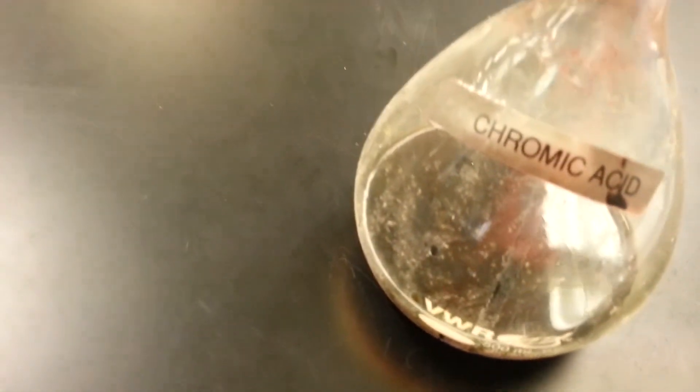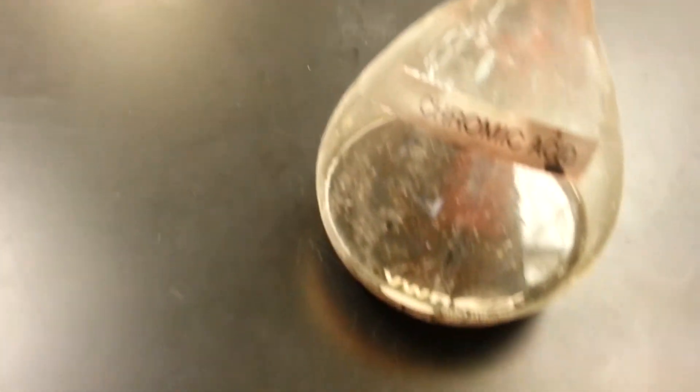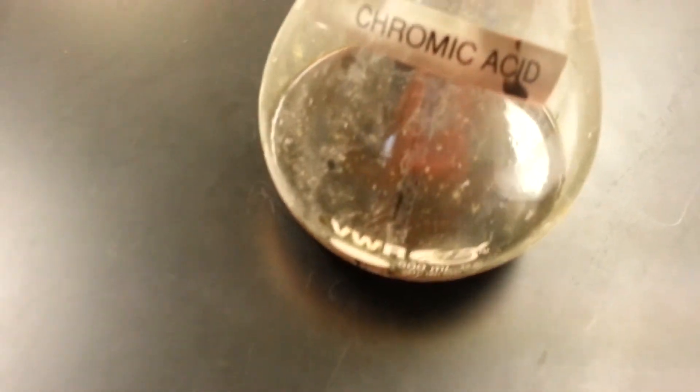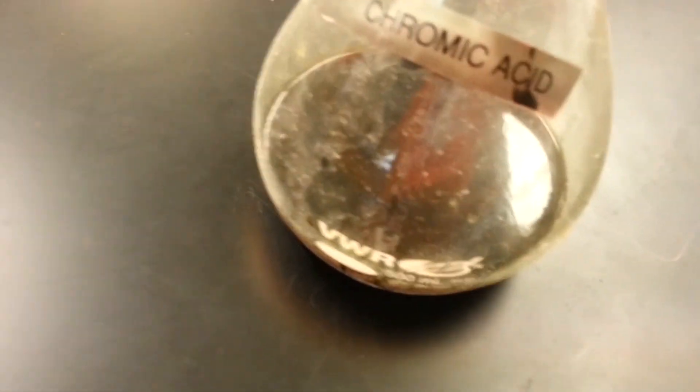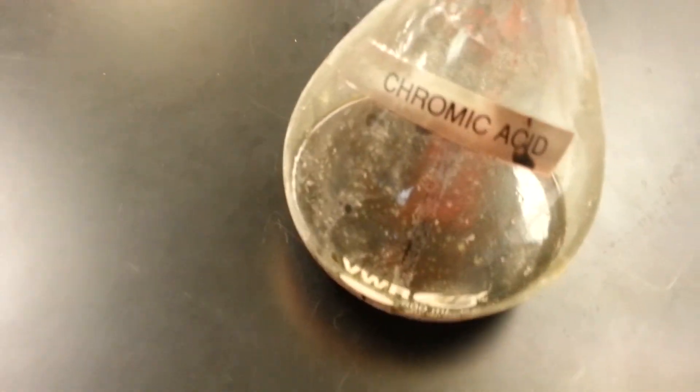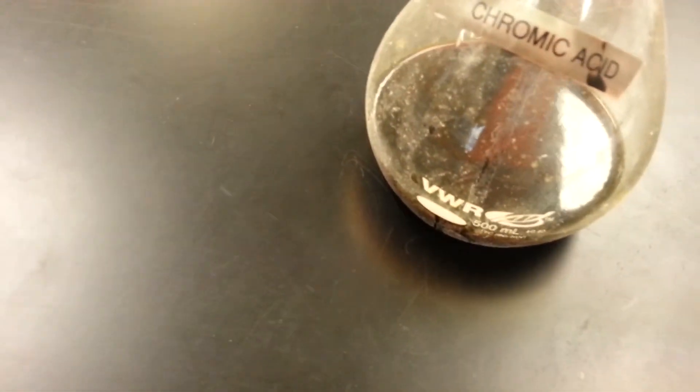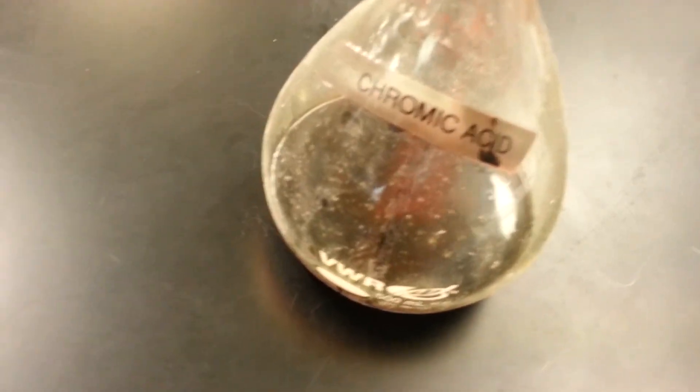That's basically how you make these four reagents. We have others, like for example, ammonia hydroxide, six molars. With ammonia hydroxide, every semester you have to add more ammonia because it loses its strength.